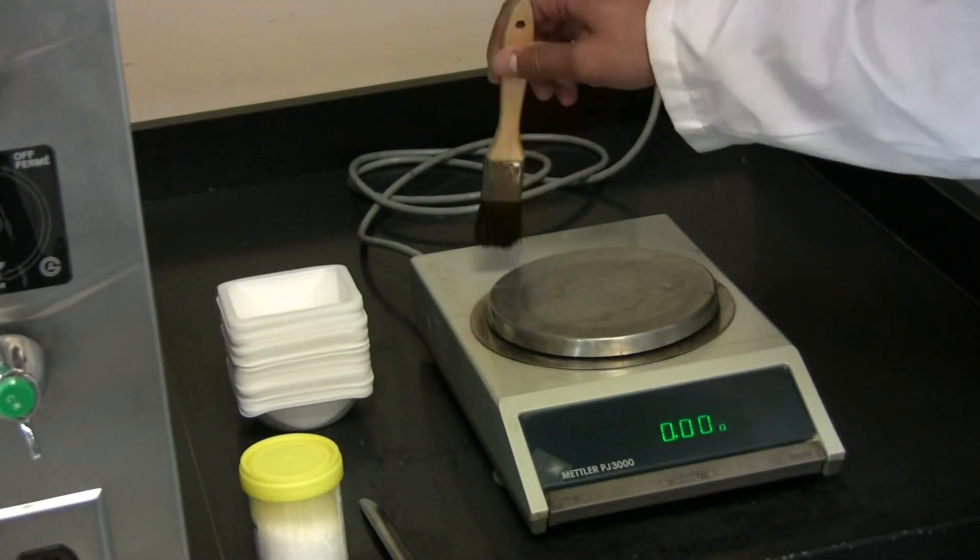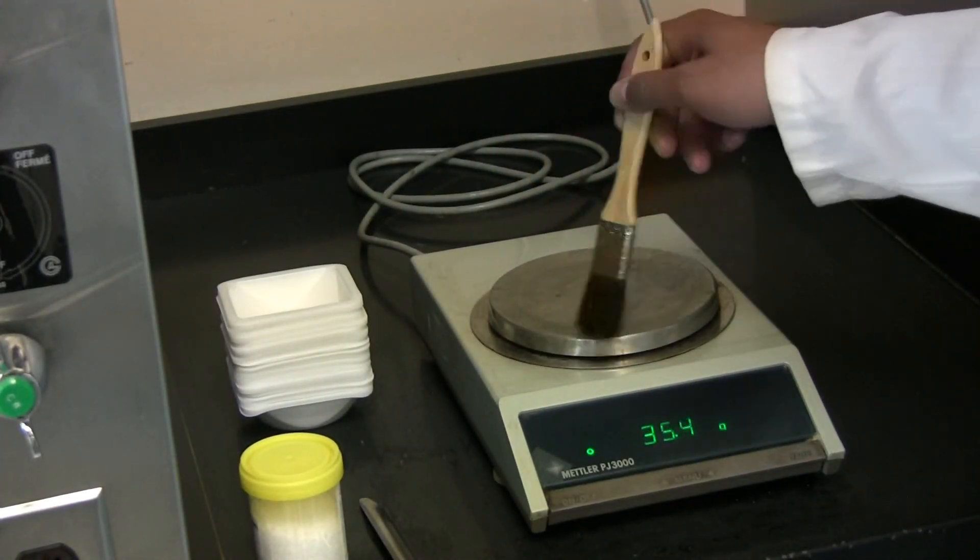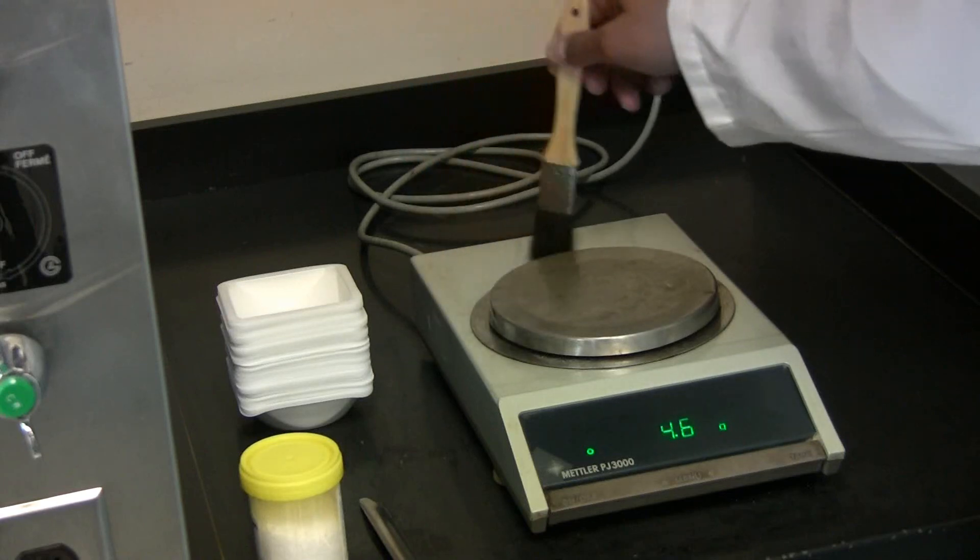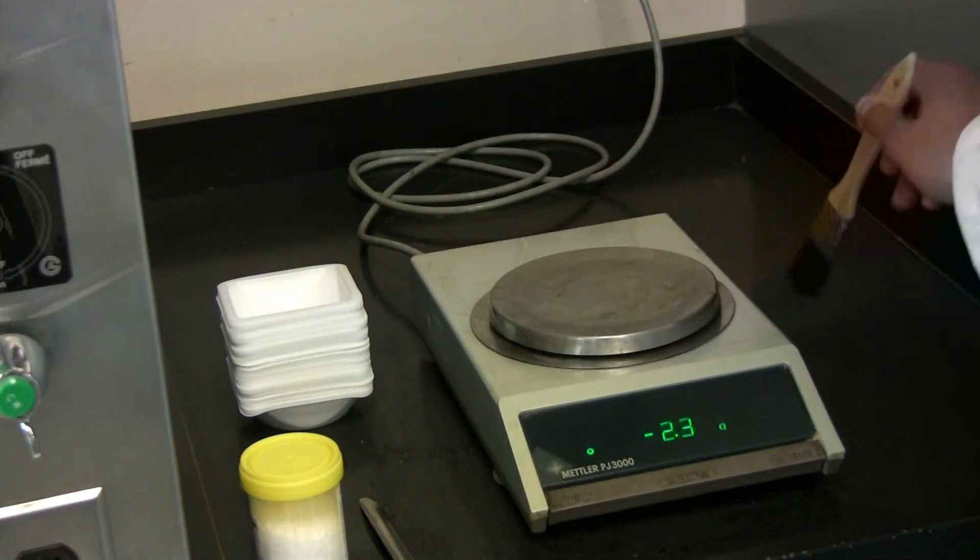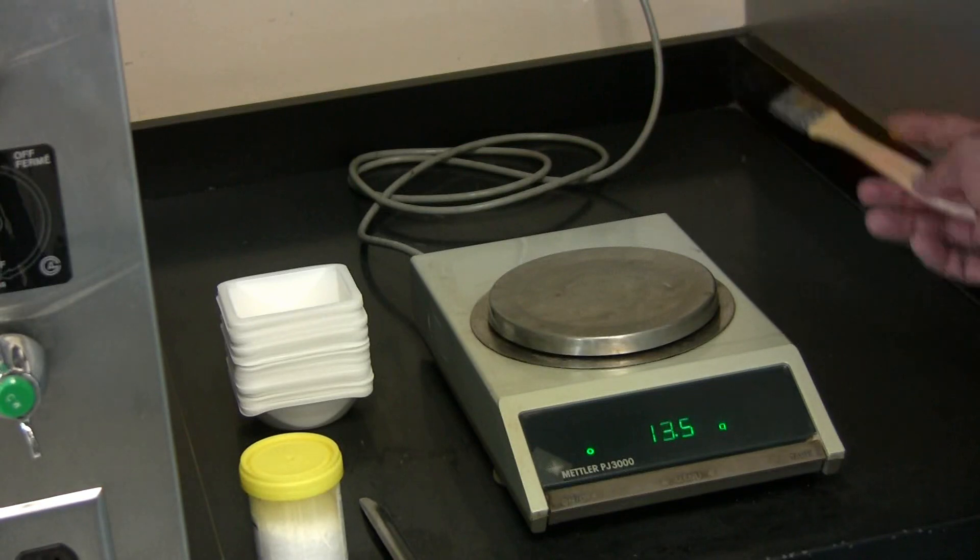Start off by taking the brush and sweep off any debris that may be left on the top loading balance. Make sure to be very thorough when cleaning it.